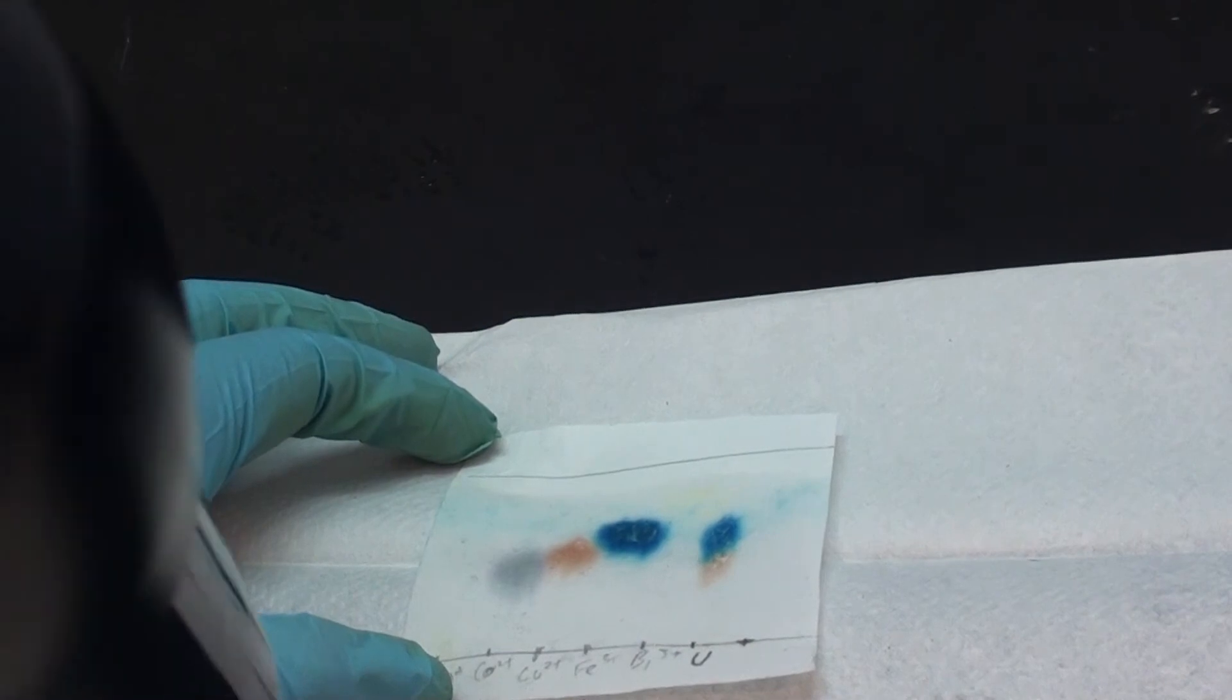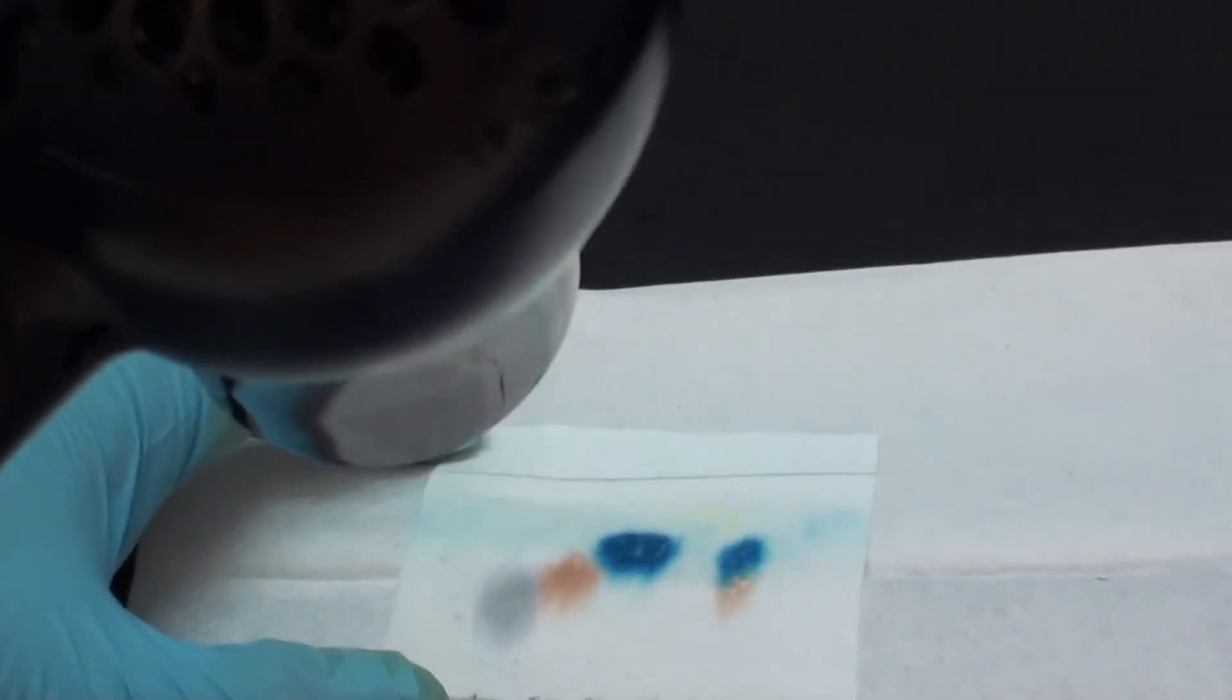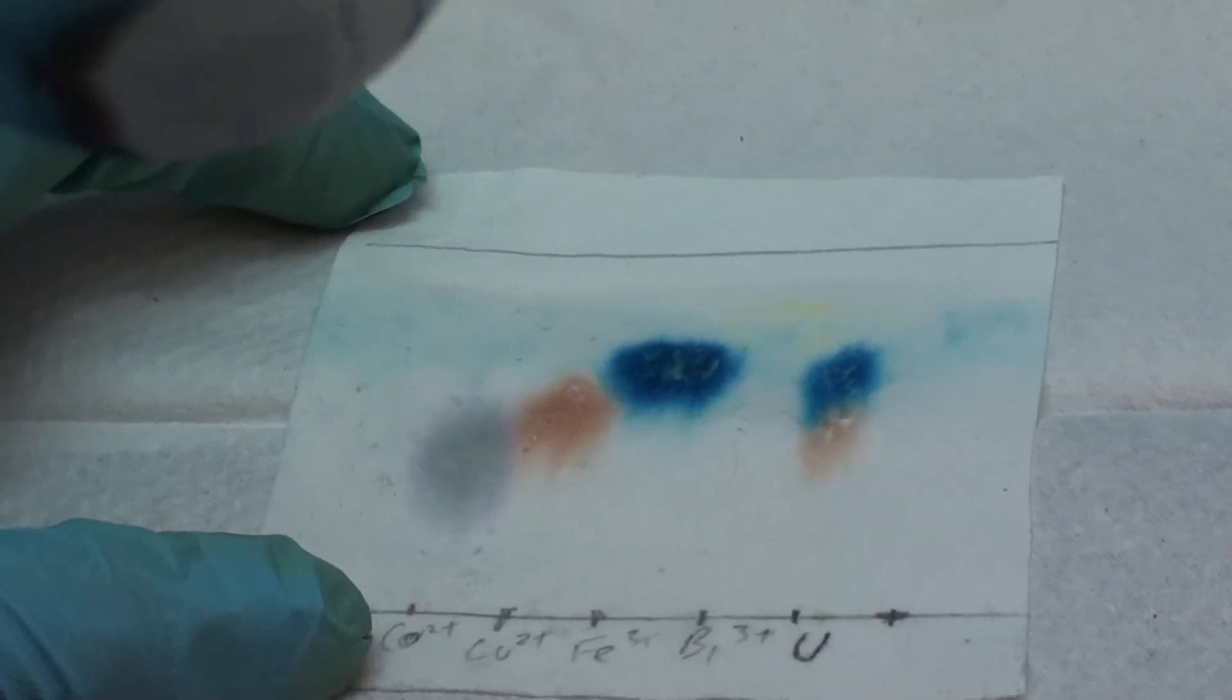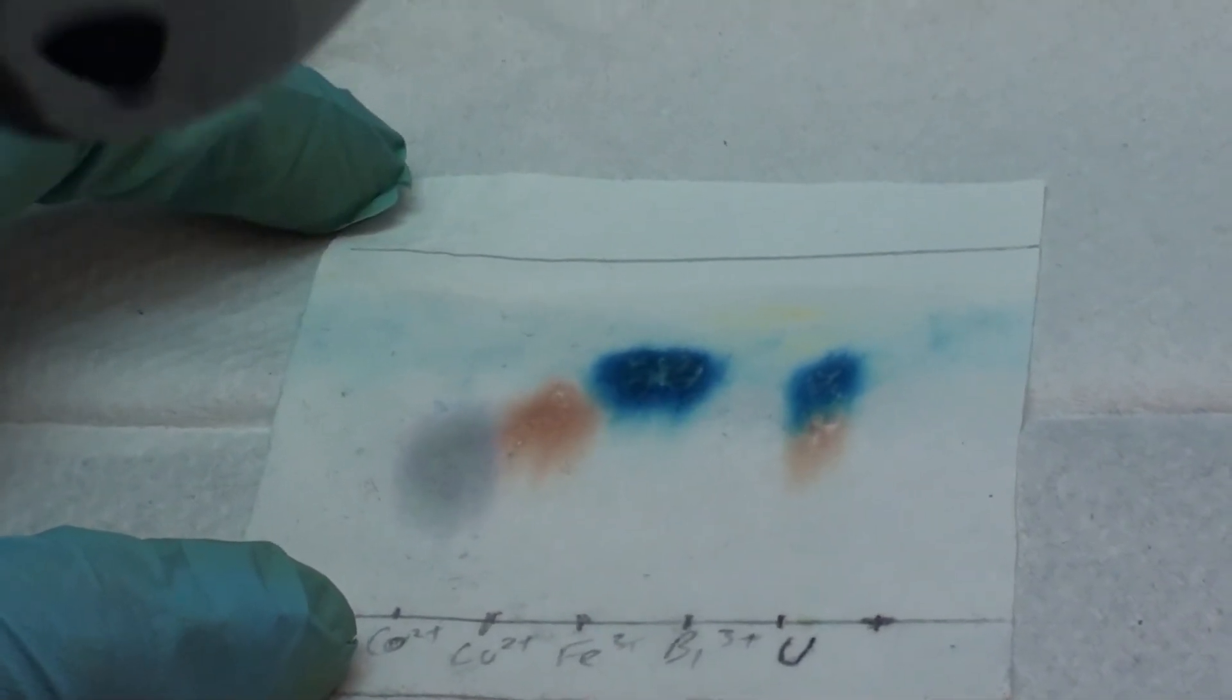Okay, so I'm going to dry this off here. Just on low. So I'll do this for a couple of minutes. That'll probably do it.